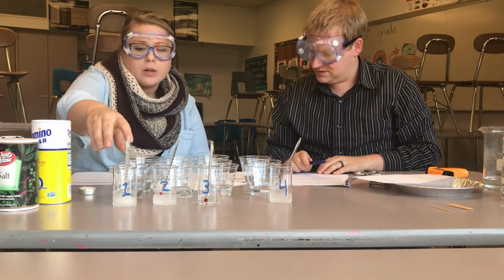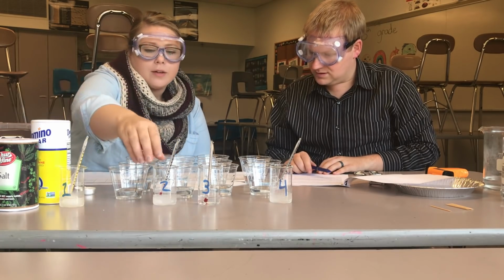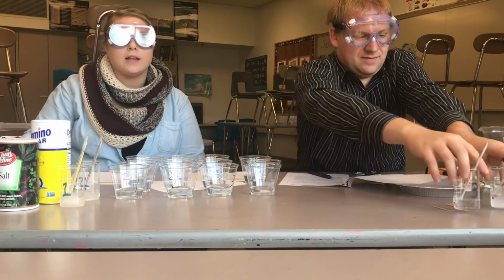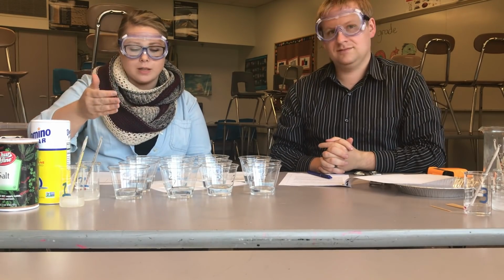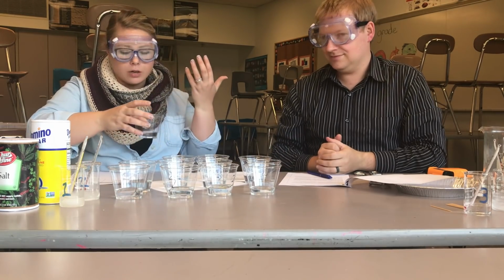So we're going to look at some other different properties of these liquids to see if we can figure out what each of these liquids are. I think the next one we're going to look at is odor. And in science, we never directly smell the odor because we don't know if it's something dangerous. So what we do, put it close and then you just waft the odors near you.